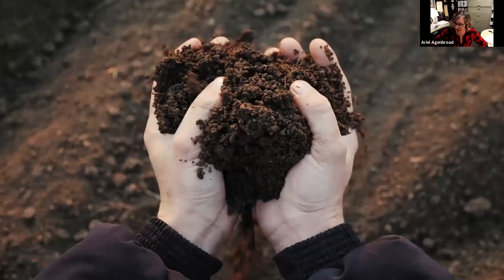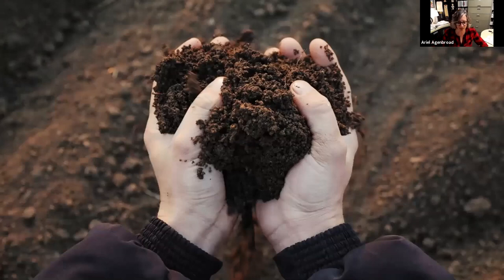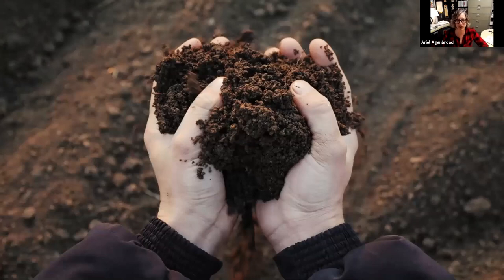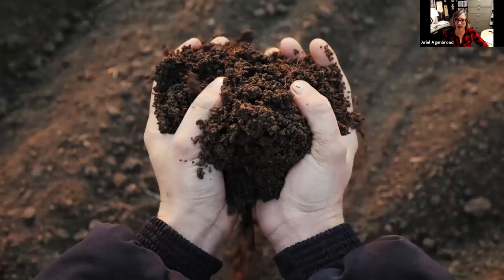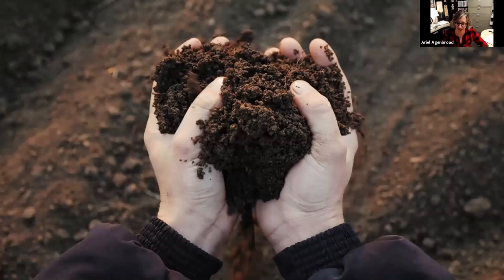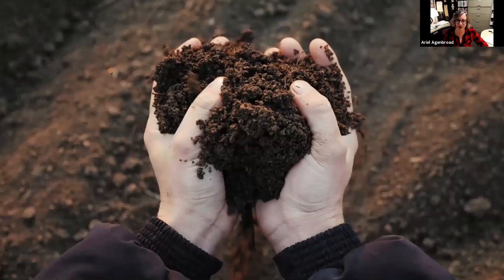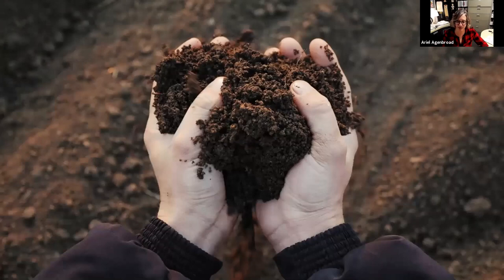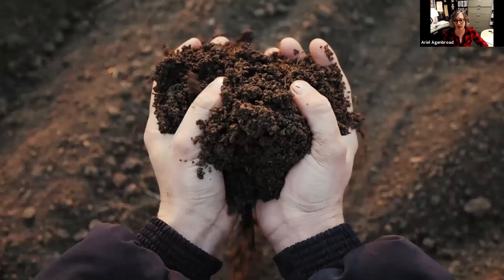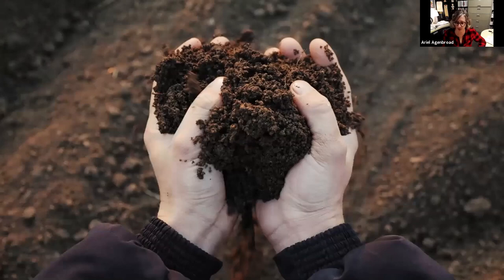And there you go — you're on your way to testing the pH and EC of soils. It can be a really good thing. We use it in our Living on the Land and Master Gardener classes prior to sending in their soil samples, partly to see how accurate we are in testing, and just to give them a heads-up of some things they might expect. Then when they get their soil sample back, we can go into it in more depth.